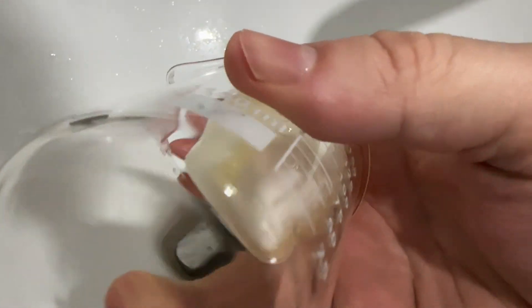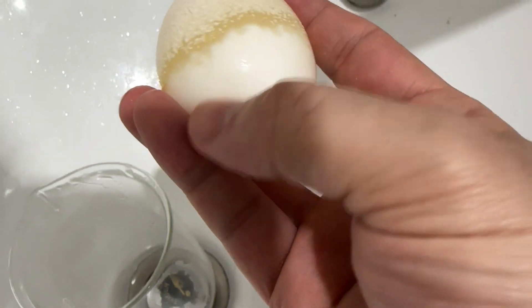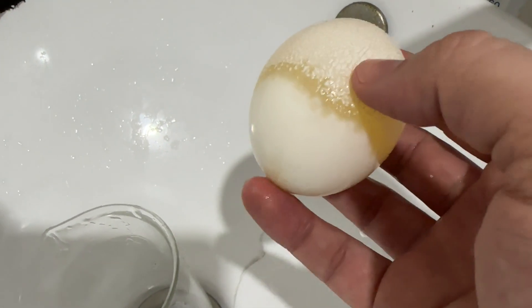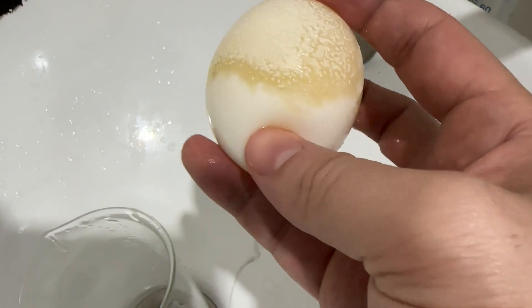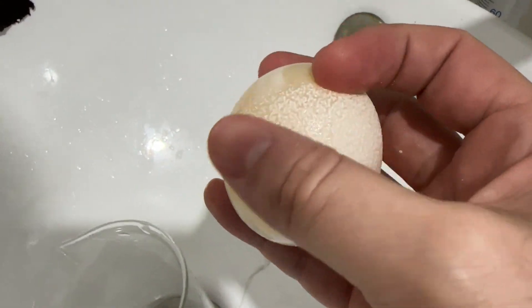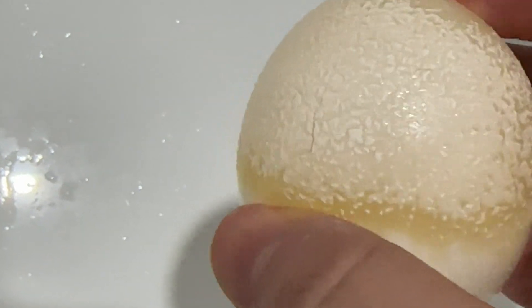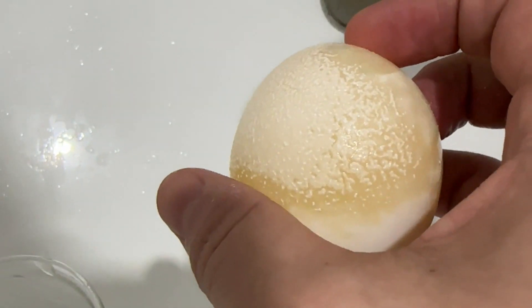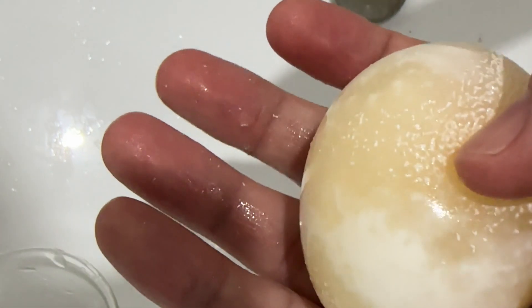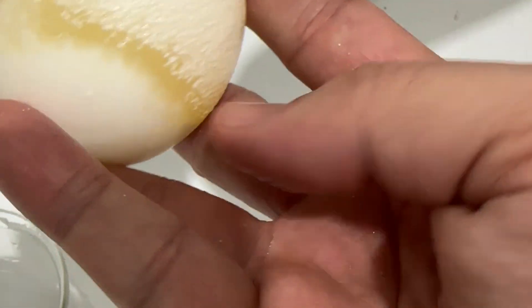I forgot to get the follow-up yesterday about the egg. This bottom part was sitting in the acid in the beaker. Not only is the shell completely gone, but that part of the egg has denatured really quickly — those proteins. The top part has this reptilian kind of look to it because so much of the hydrochloric acid was reacting and foaming out that the beaker started to become empty. As it's sitting there exposed, it's still kind of coming off — you can see little bits, like it's shedding still.